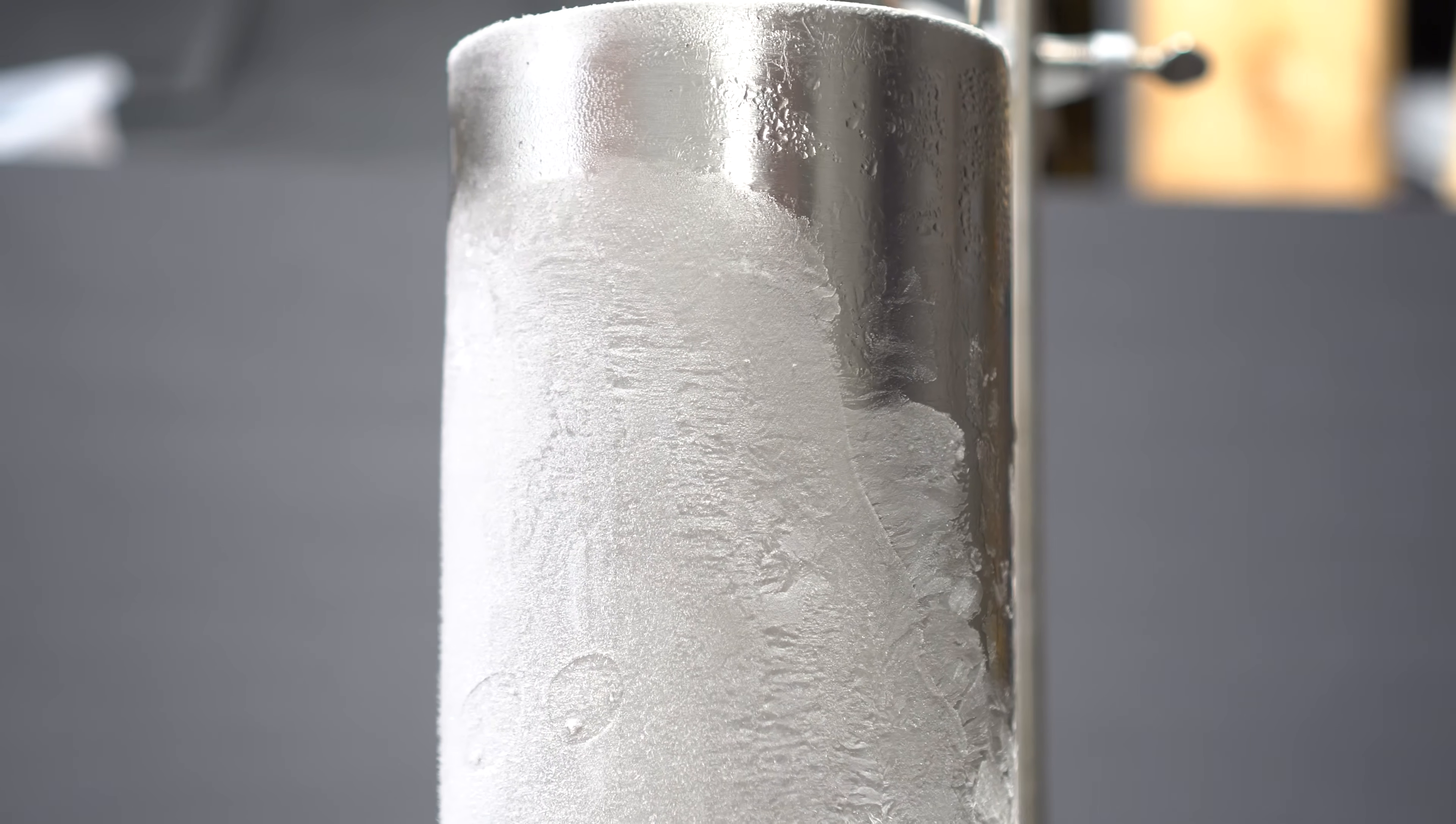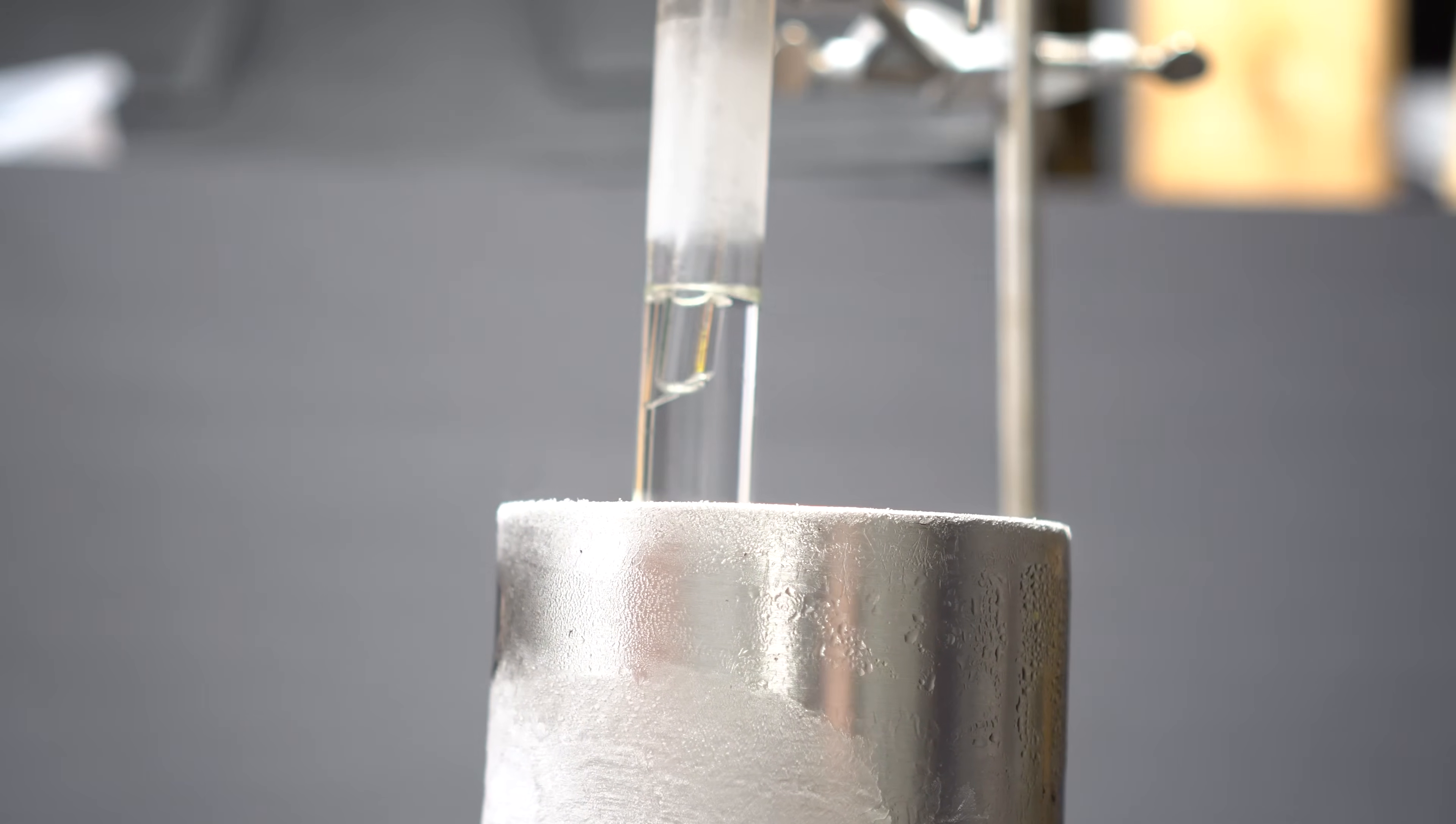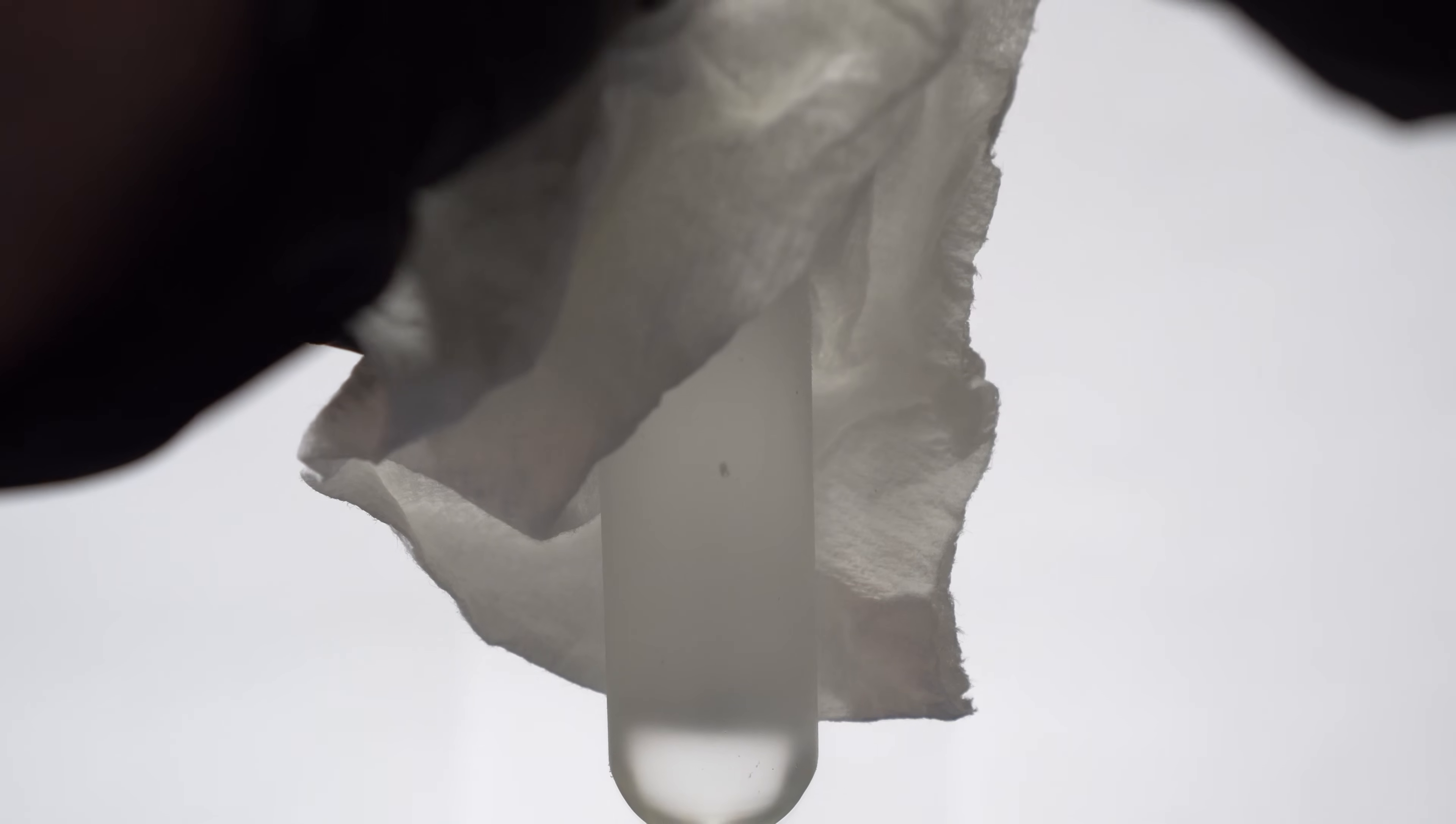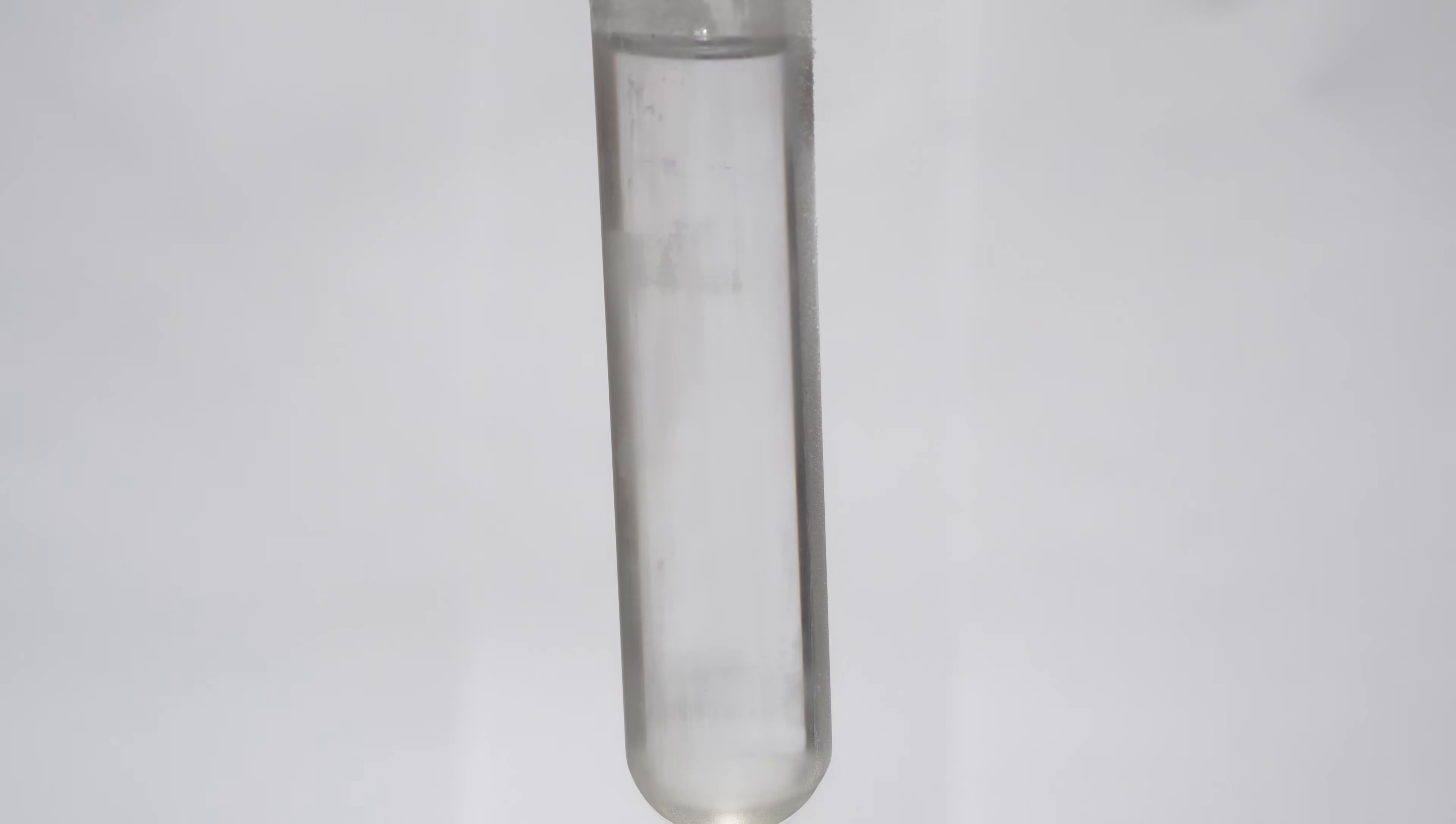After letting the reaction run for some time, I decided to check how much ammonia we got. Turns out, we got a lot of it. Such a beautiful, non-dangerous looking liquid, but it's actually really dangerous. One, it's very corrosive to your tissue and you can get frostbite from it. I actually had a very big issue with frosting of the test tube and it was very hard to see inside. This pissed me off because I wanted to show the beautiful blue color when you throw sodium in there.